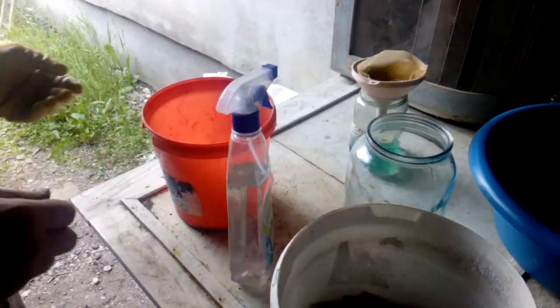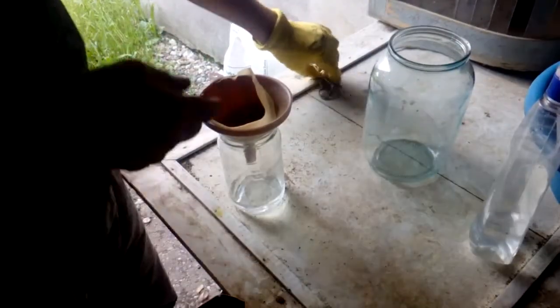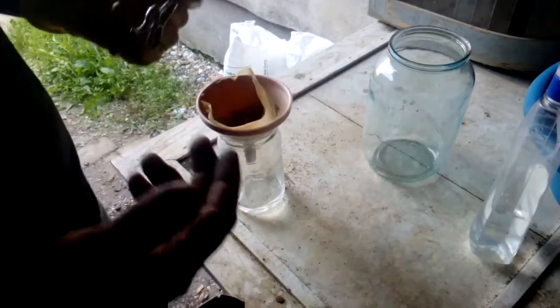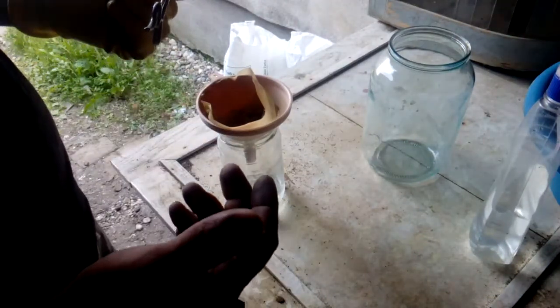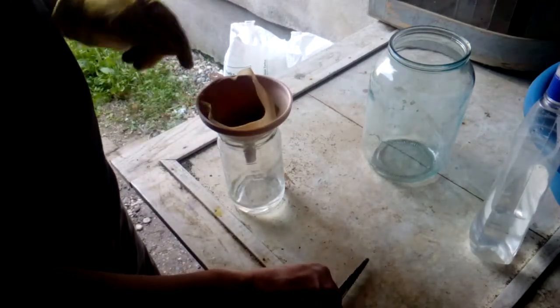This one still has some gold on it, so we keep it inside for next time. Filtering is now finished. Look at all the gold foils. Now we could just straight smelt this and we'd probably get some 14 karat gold, maybe 16 or 18 karat — but probably around 14.